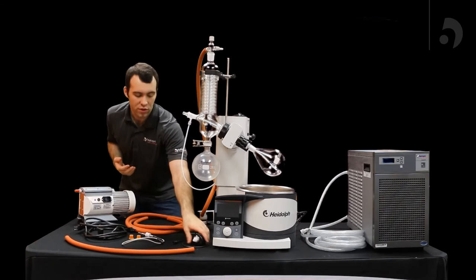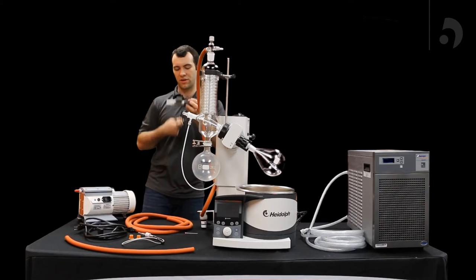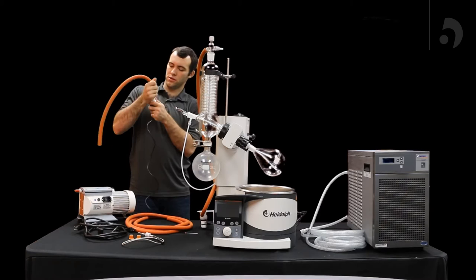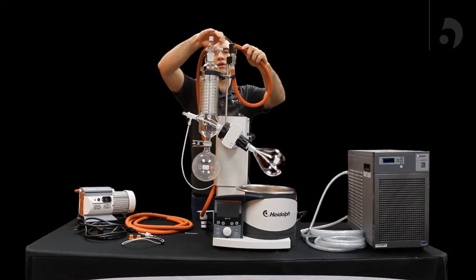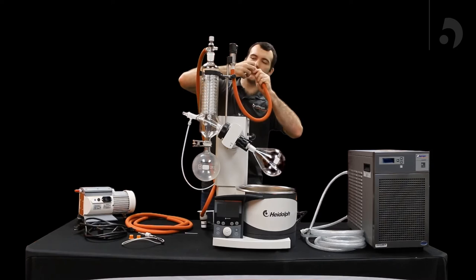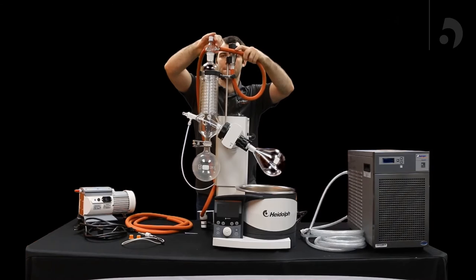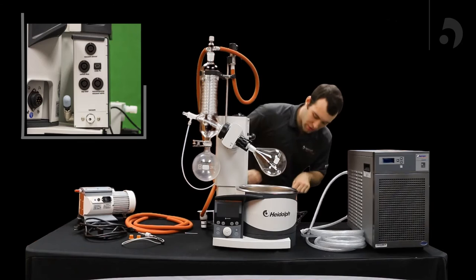Once that is finished, we can move on over to the vacuum sensor. Grabbing another piece of tubing that is the length you need, plug that over the connector. Using this pole you'll find on the bottom, slide it over your support rod. And then using the other barbed fitting in the vacuum fitting, you will put that on the other end of the tube and screw it back up. Then with that completed, the cord that goes from the vacuum sensor will go to your vacuum box in the port that says vacuum sensor.